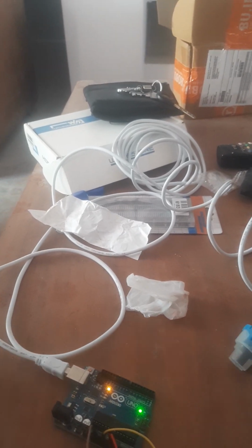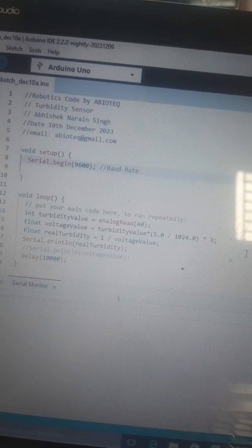And then of course this Arduino board requires some kind of power as well, that is being interfaced by this USB port. And there is an integrated development environment, the IDE, maybe you can see in the bigger screen, and that's where the code is written. And here is how the code looks like. We put a baud rate of 9600, and then we do certain calculations to convert the 5 volt into appropriate measurement, and then we take an inverse of that to tell about the turbidity.